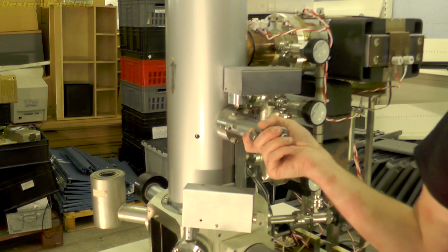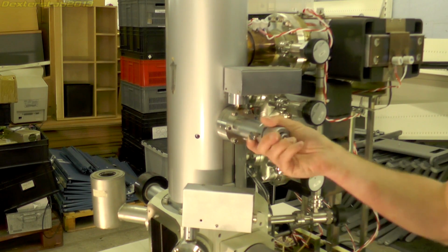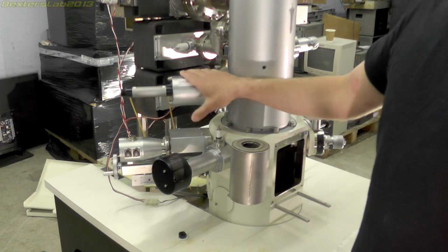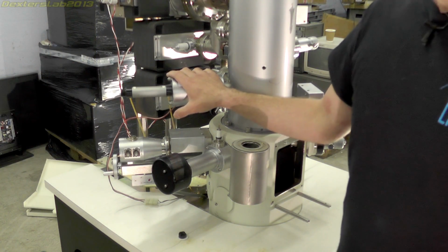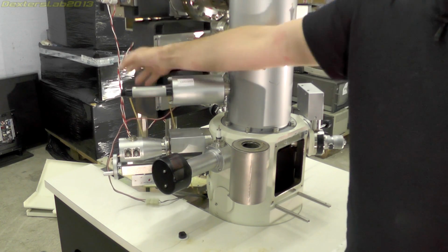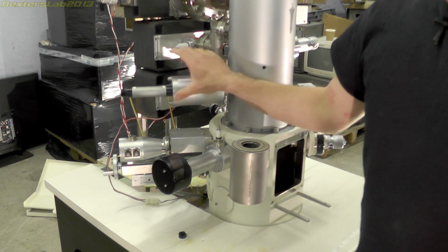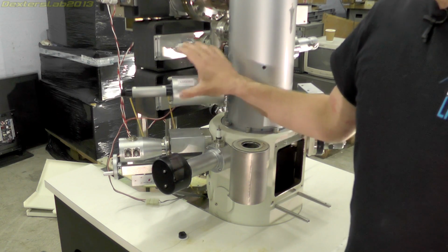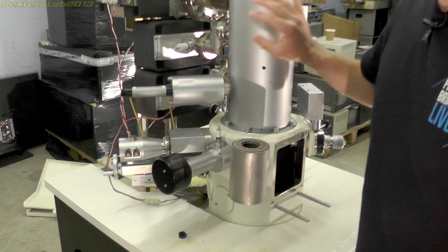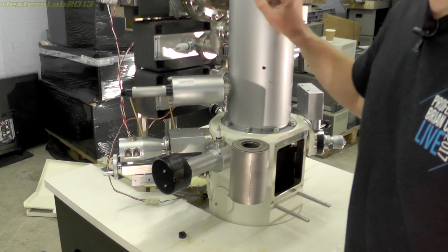This device on the side is for electron beam monitoring, and there is a small detector box attached to it. This seems to be some kind of pneumatic device. There's some little air pipes just here. I'm not entirely sure what this is for, but I think it might be some kind of valve to close off the column from the sample chamber. We should know a little bit more when I actually take this to pieces.